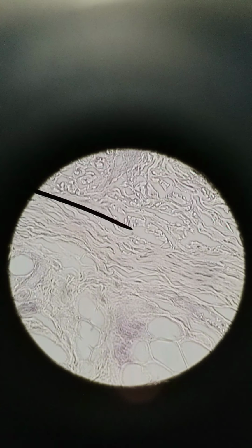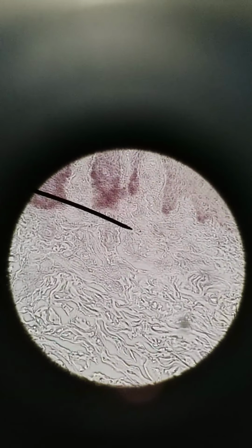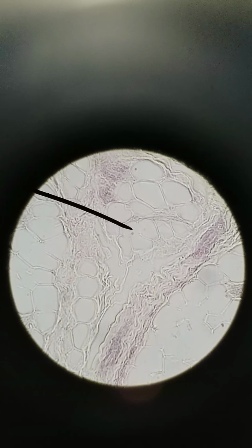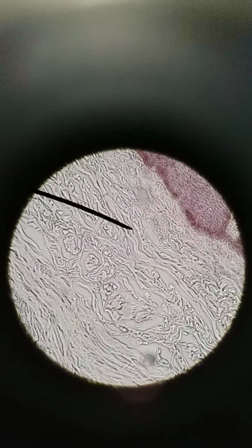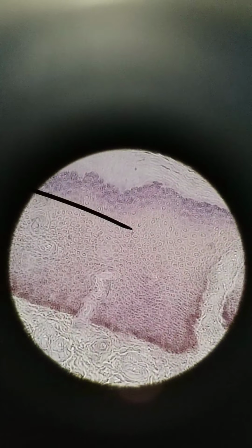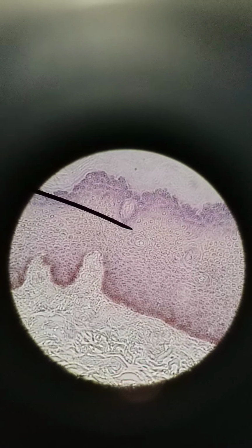Basement membrane is just a collection of basically like sticky proteins that keep it down, and then we can see the rest of the dermis. This is the papillary layer, it is very, very thin. So just this region here, along with the bumps up here, that's just areolar connective tissue papillary layer. And then deep to that, all of this is reticular layer. All this is reticular layer. It's dense, irregular. Go deeper to that, and then that's where we can find our subcutaneous, our adipose. That's what thick skin from the palm or sole, from the palmar or plantar region looks like.